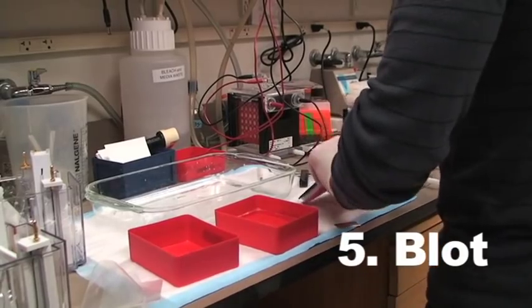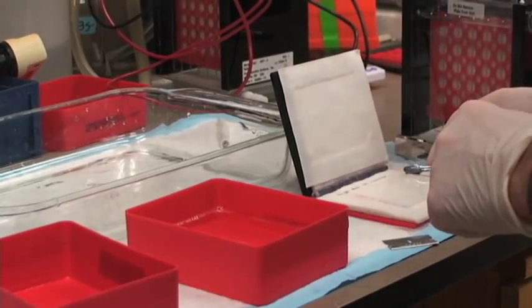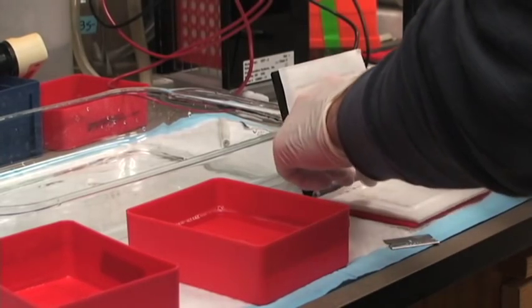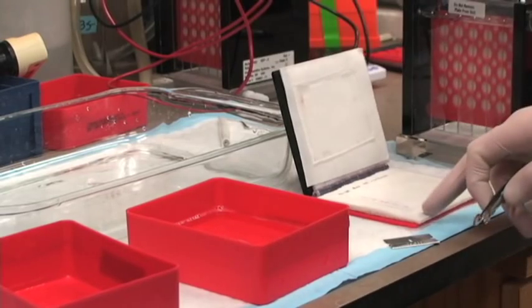Now our proteins have been transferred to the nitrocellulose membrane, and we're going to probe them with an antibody that recognizes a specific protein of interest. You want to take a look at the membrane, actually. You can see the ladder.